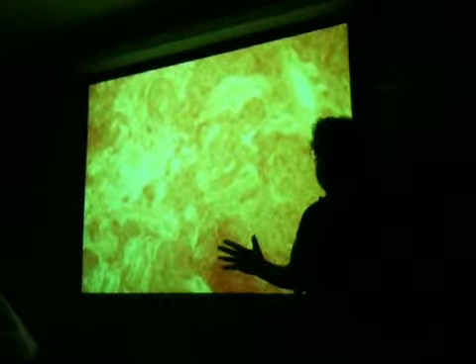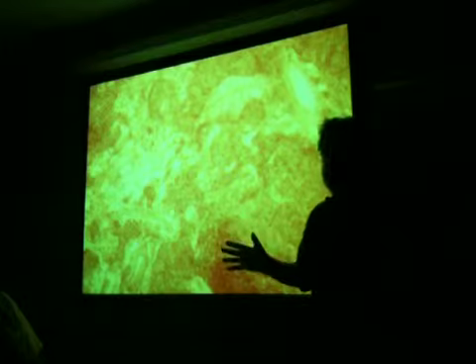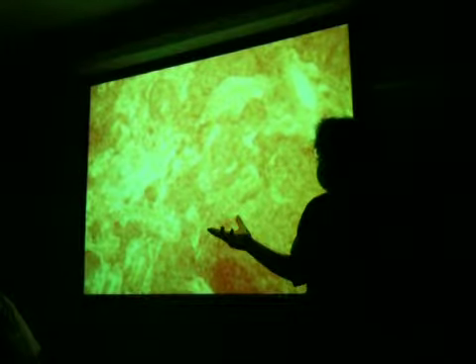Now, all this stuff that is not the lymph nodule, but lymph tissue, is called diffuse. It's not highly concentrated. It has no germinal center, so it is diffuse. Any of this stuff in here. I'm not going to point to any of these spaces because we're going to have separate names for that. So these lymph nodules are not diffuse, but all this is diffuse. We did the germinal center.